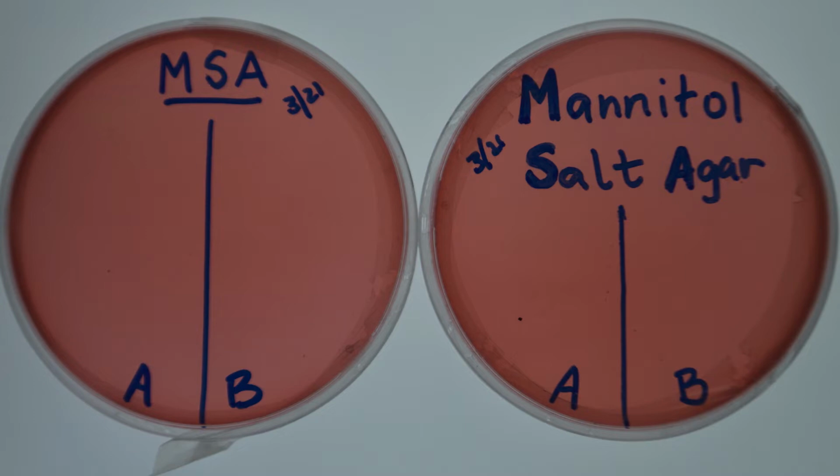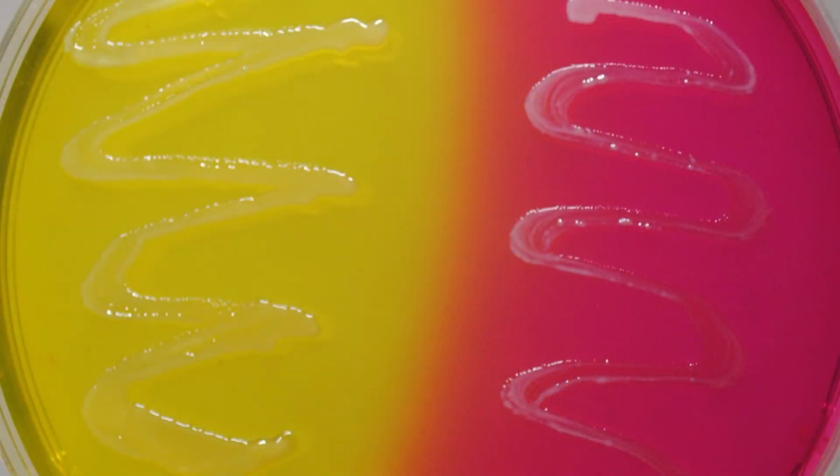The reaction is a typical carbohydrate fermentation with the production of excess hydrogen ions. These cause the pH of the medium to drop, become acidic. MSA also contains the pH indicator phenol red. This is the same indicator that is used in the carbohydrate tests of the Enterotube. Phenol red will impart a bright pink color at a pH above 8.2. It will also have a yellow color at a pH of less than 6.8. After inoculation, a positive result is recorded with a change in color from the pinkish color to a yellow color.